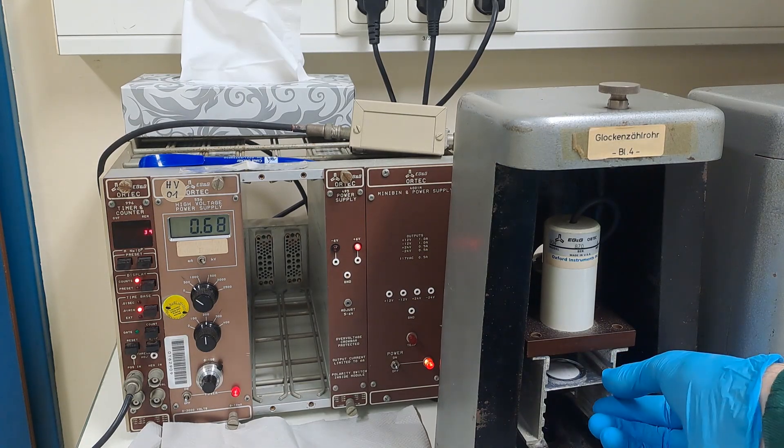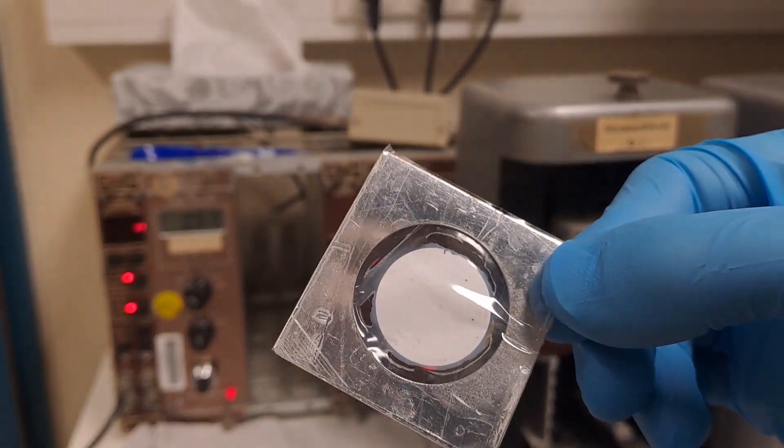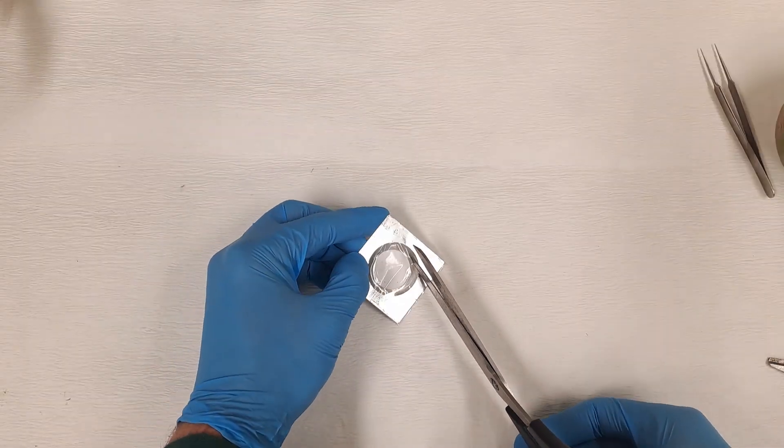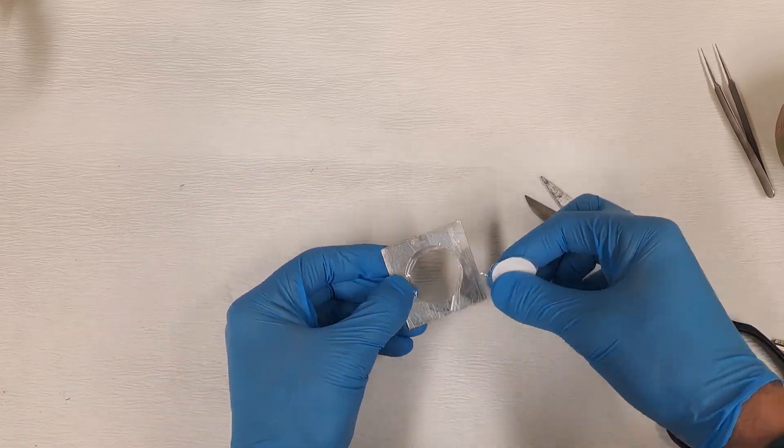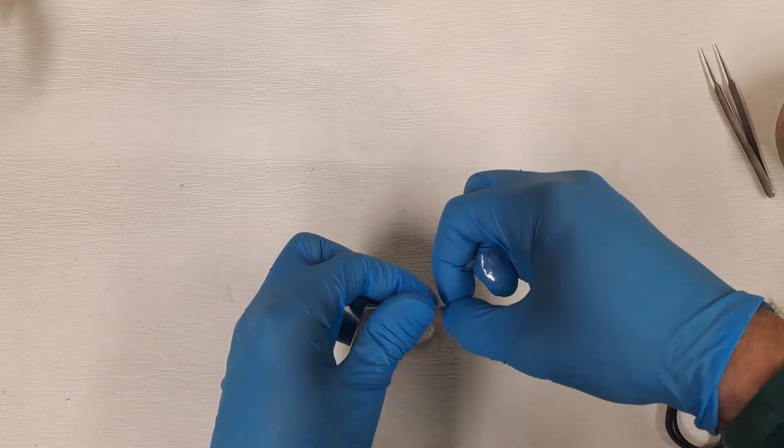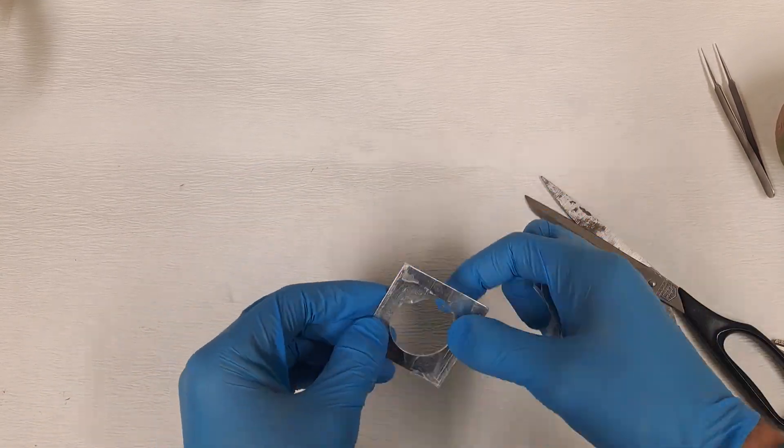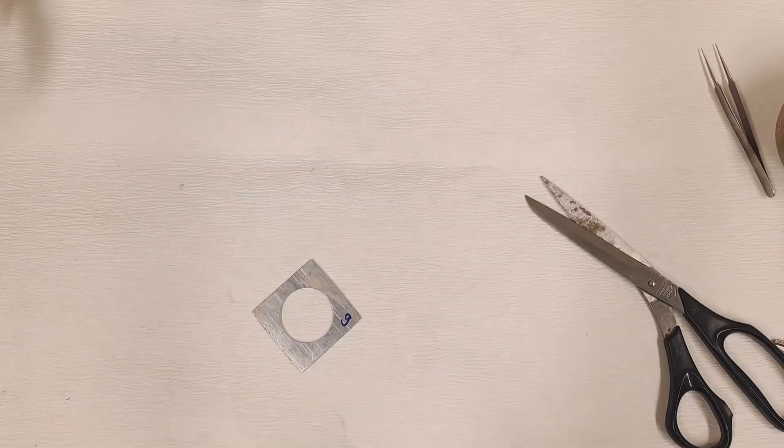Disposal, just cut out the filter through the adhesive tape and then you can easily remove everything by hand. Make sure to wrap the adhesive tape remnants in a glove, remove the glove properly and dispose of them in a bundle in the sulfur-35 waste container.